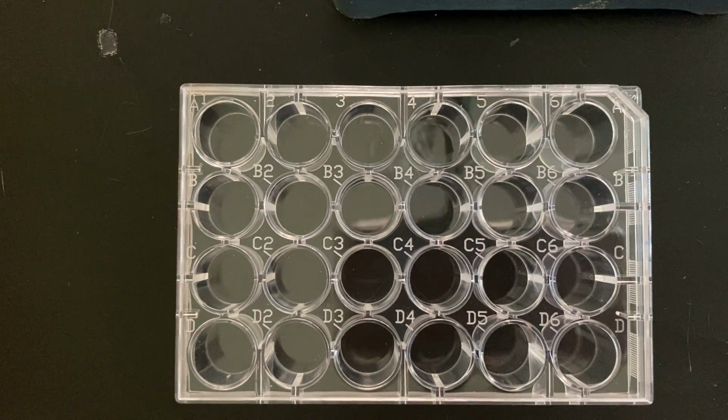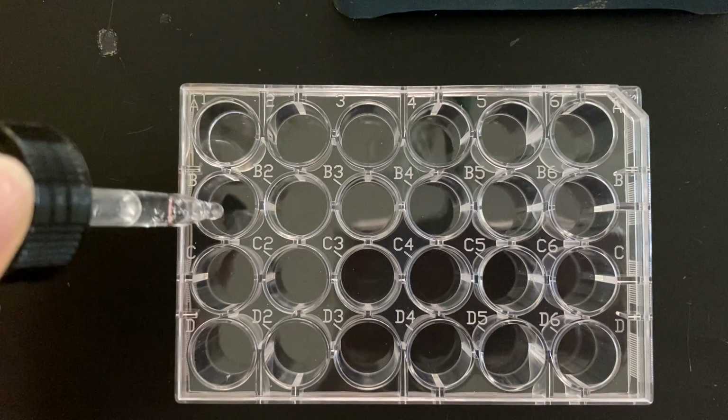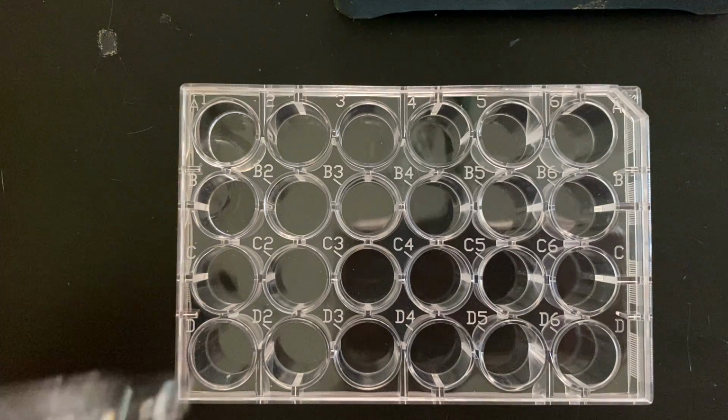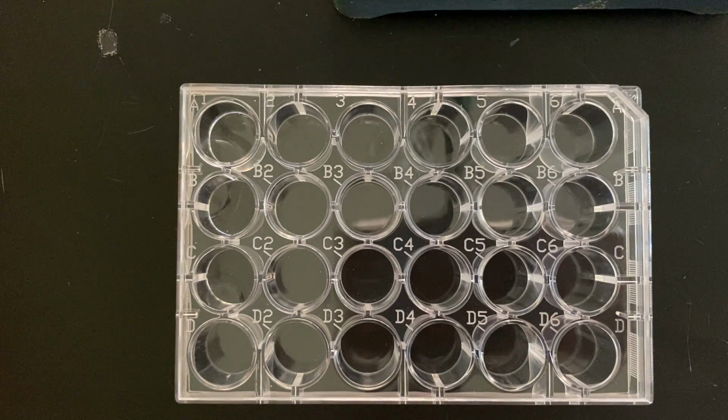So we're putting magnesium into wells 1, and we're going to react them with the 3 different solutions, so 3 wells. So I just did 5 drops of each. That should be enough for you to see everything. Calcium is next.